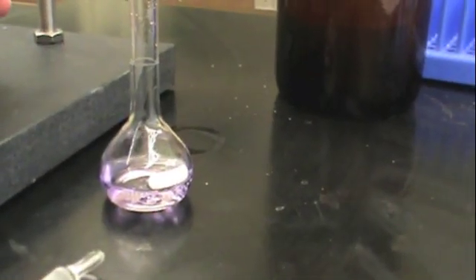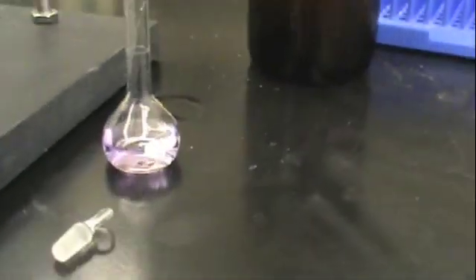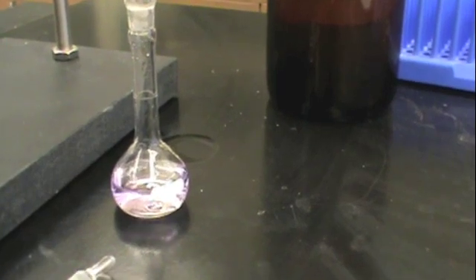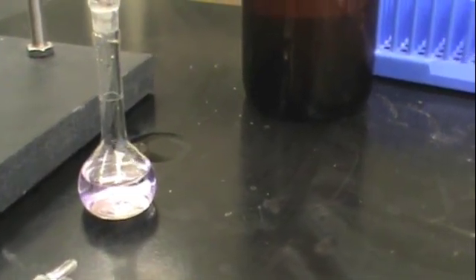You want to make sure to only use distilled water when you're preparing dilutions. Keep adding distilled water to your volumetric flask until you get to the neck.